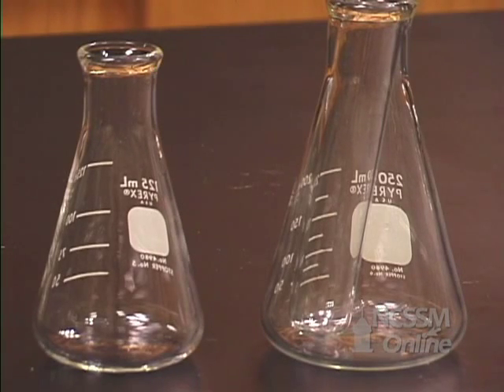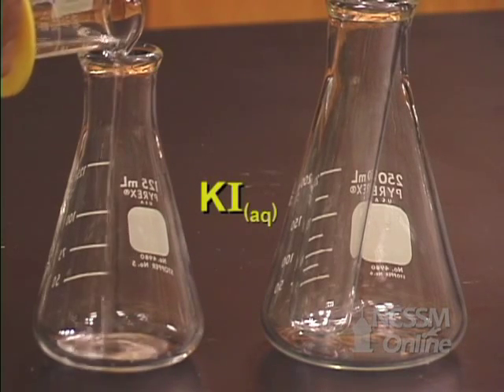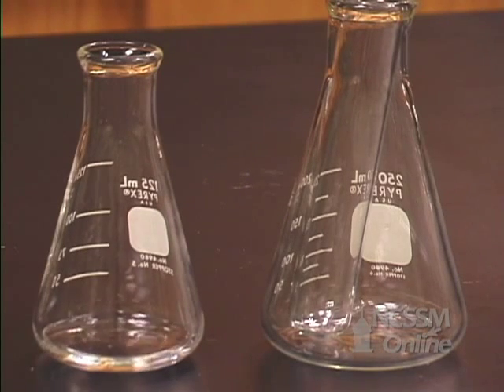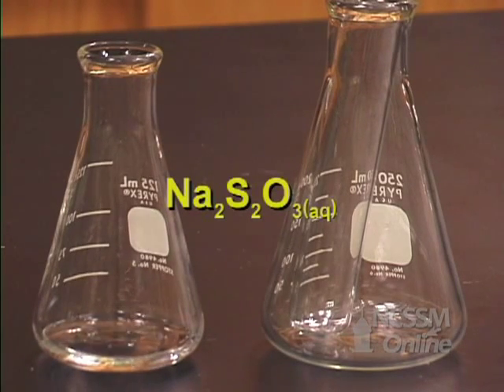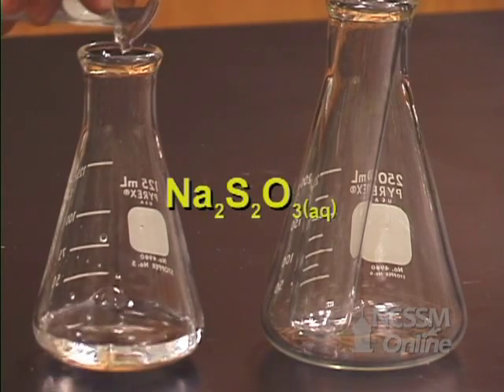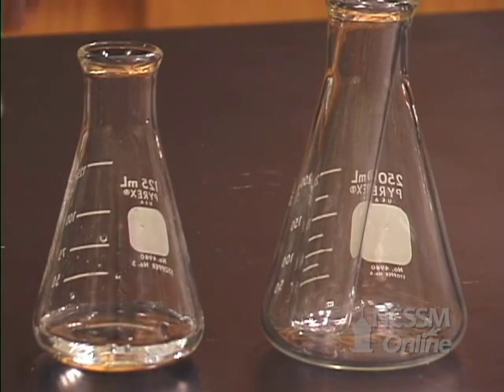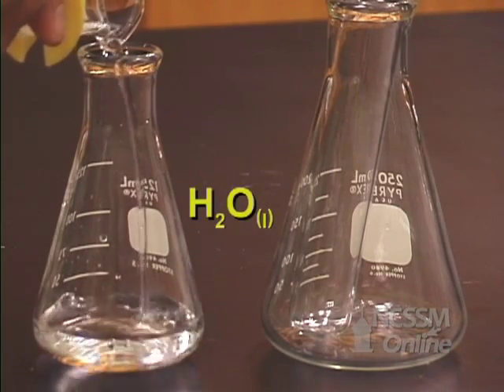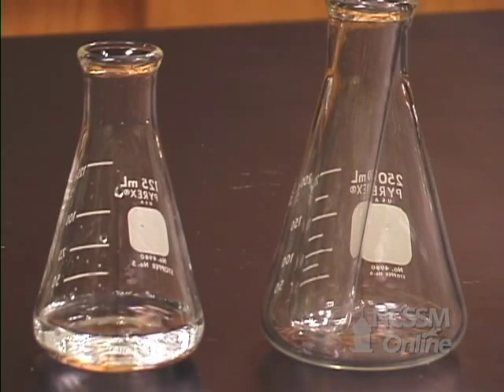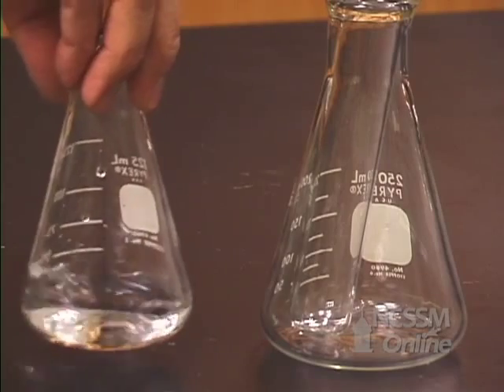In the 125 milliliter Erlenmeyer flask, we will add 10 milliliters of potassium iodide solution, 10 milliliters of a solution of sodium thiosulfate, and 10 milliliters of water. We will swirl the flask to make sure the solutions are mixed.